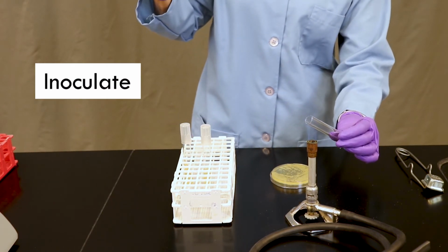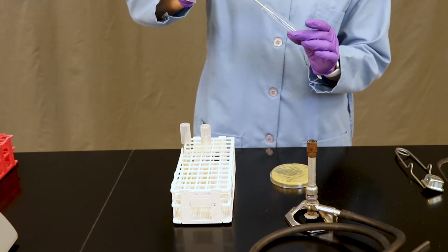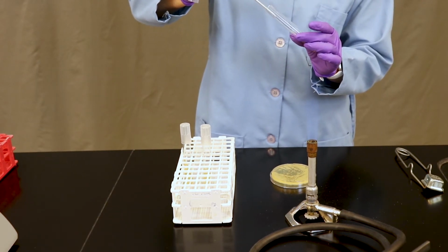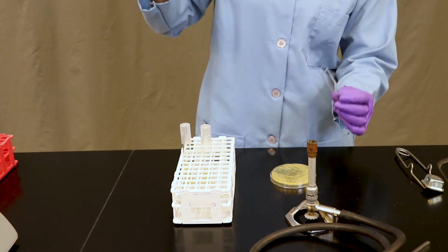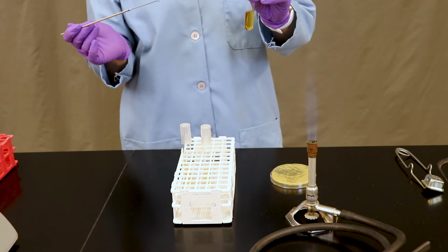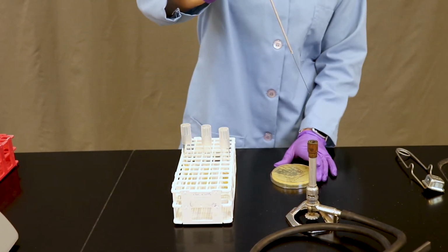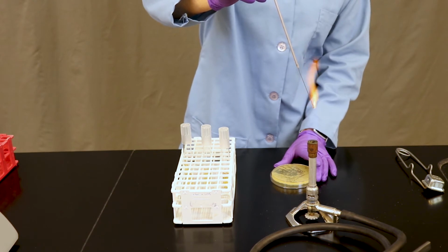So for the broth, remove the cap with the dominant hand. Dip the colony into the broth and swirl around. And though it doesn't look like much at the moment, you have just inoculated that type of media with your bacteria. Sterilize your loop once more.